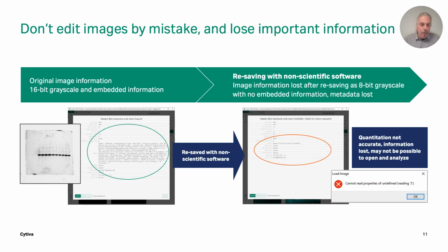And like I said, here's an example where we've taken the original 16-bit TIFF image, and it's obviously got a lot of embedded information in there. You can see here in the header, there's a lot of information about how that image file was captured. But then they've gone into non-scientific software, something like PaintShop Pro or Adobe Photoshop, and then they've resaved the image, and it will probably save as an 8-bit image. You're going to lose that metadata. And then again, it's not good for quantitation, and it's going to get queried when you submit that data to wherever they're going to be looking at it, whether it's a regulatory body or a journal.